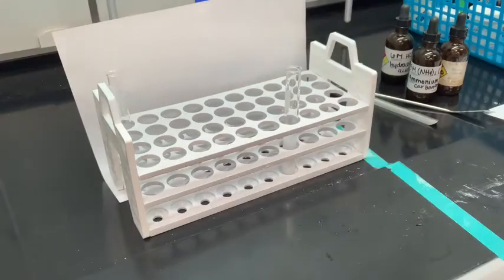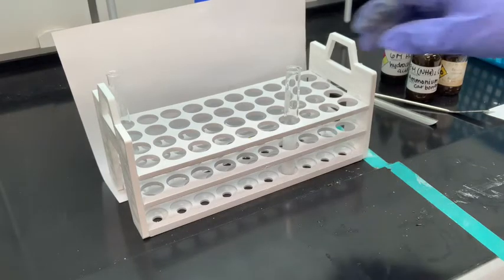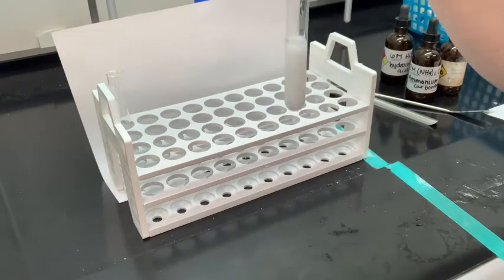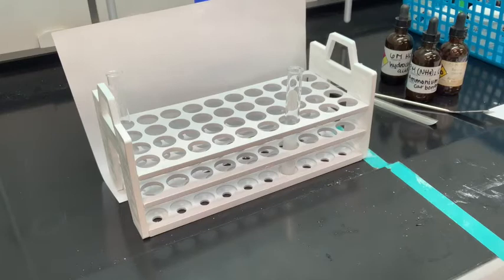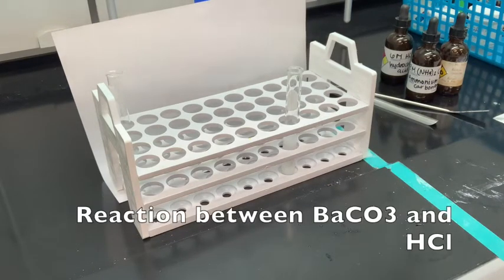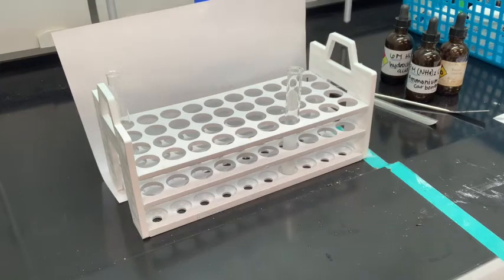We've waited a while for the reaction between barium chloride and ammonium carbonate. The book asks you to decant, let it settle, pour it off, and add water — but we're not going to do that as it would take too long. The white solid in our test tube is barium carbonate, BaCO₃. Now we're reacting the barium carbonate with hydrochloric acid, HCl. Our reactants are BaCO₃ plus HCl.